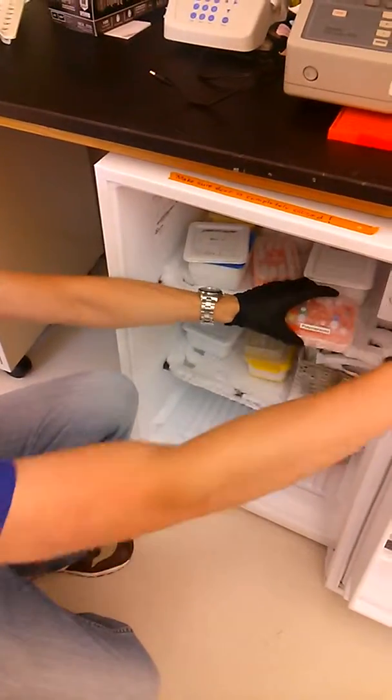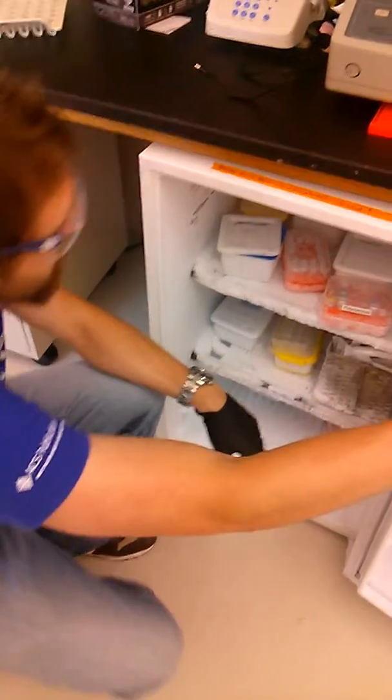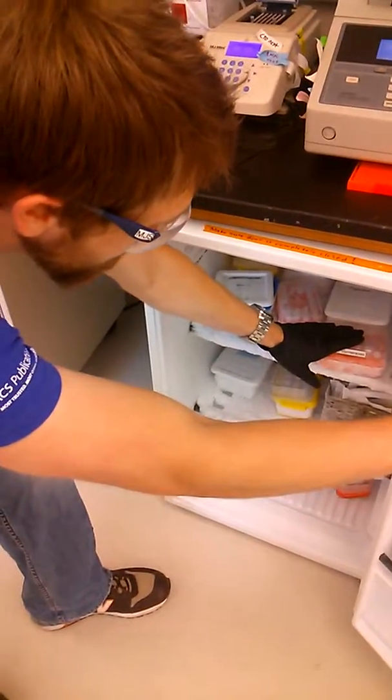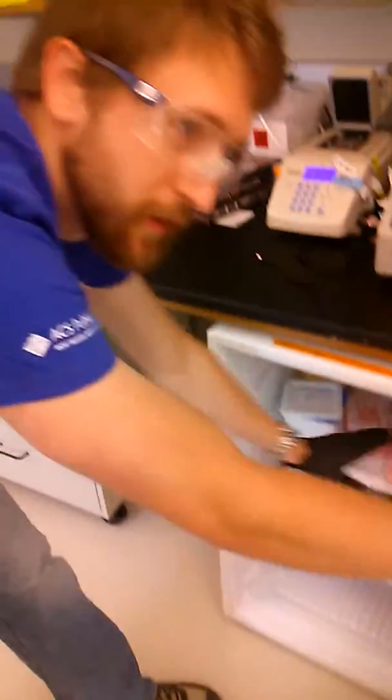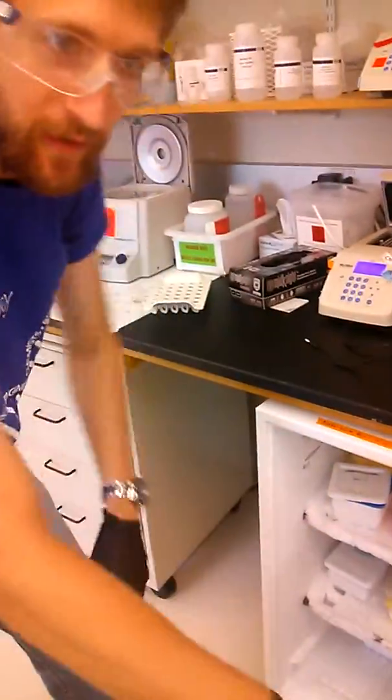In this case I've already gotten my polymerase out and it's over on the bench. So there are other reagents that you'll need that are in the polymerase boxes and some of those need to be thawed. So you want to think ahead when you're going to do your PCR and take those out so they're thawed.